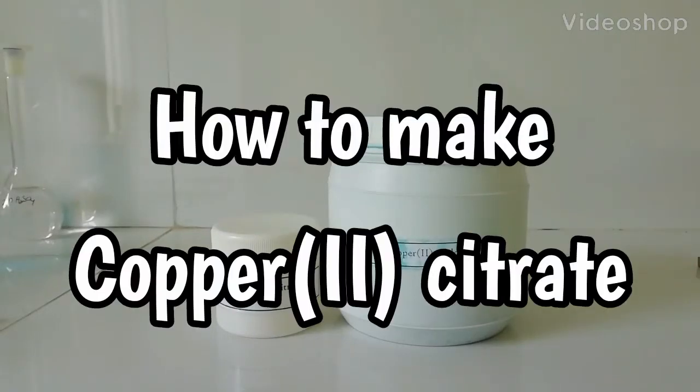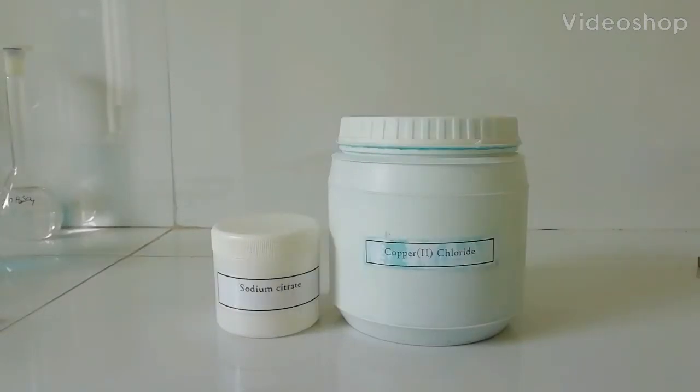Welcome to my YouTube channel. Today we're going to make an interesting copper complex, copper citrate. From this copper citrate we can make pyrophoric copper, which means very fine particles of copper metal.